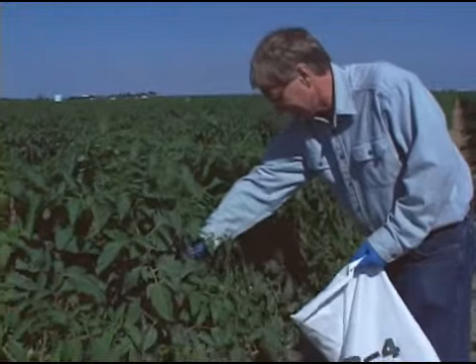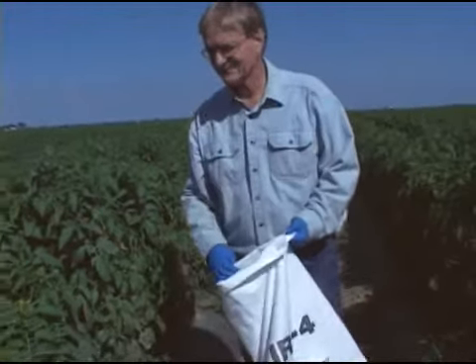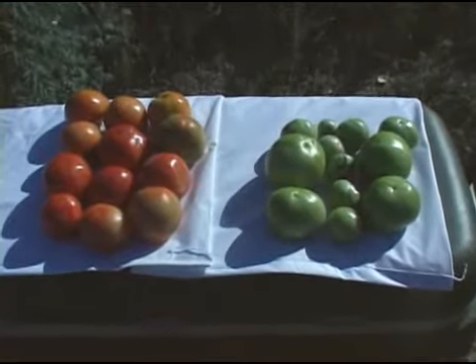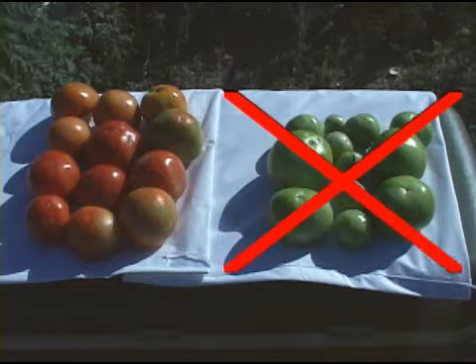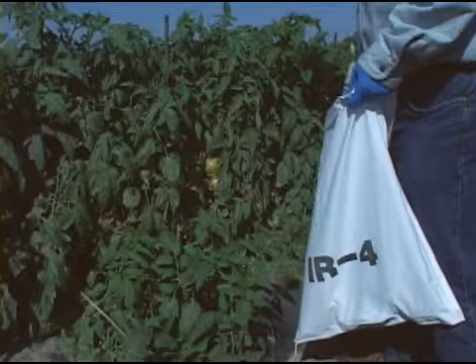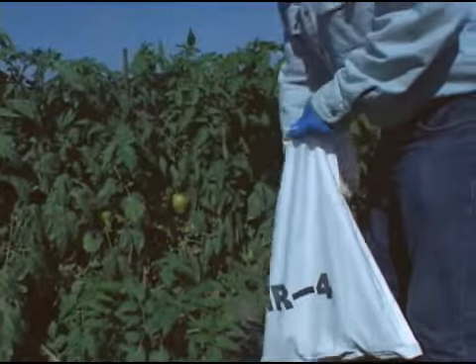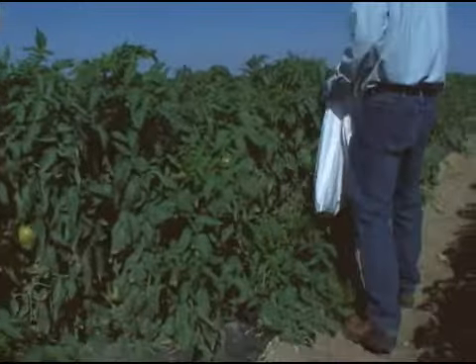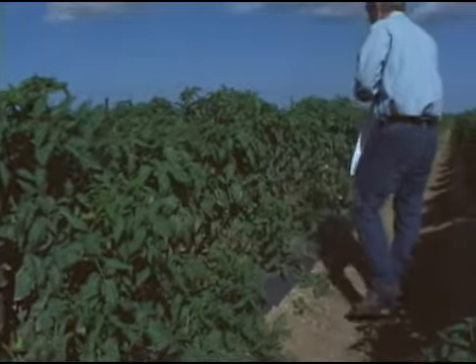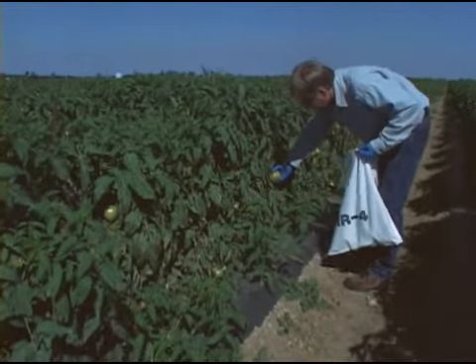Harvest the tomato fruit from the untreated control plot before spraying the treated plot. The fruit does not need to be red. The fruit may be mature and still appear partly green. You should only harvest large fruit of a similar size. Wearing the new disposable blue gloves provided, take fruit from the top and bottom of many different plants. Collect at least 12 mature fruit weighing at least 1.5 kilograms in each of the 4 sample bags.